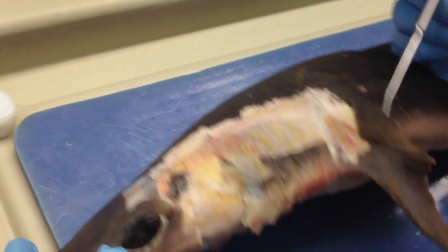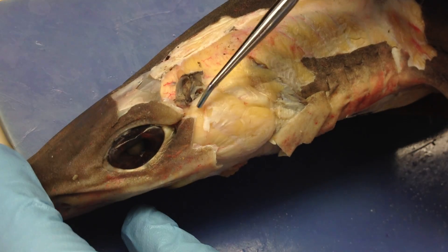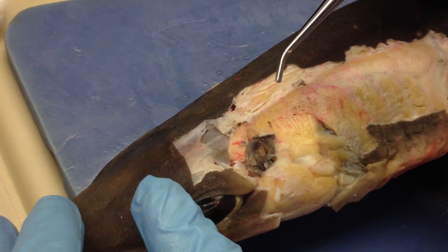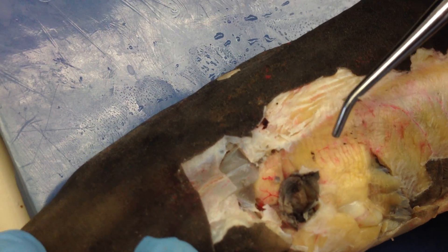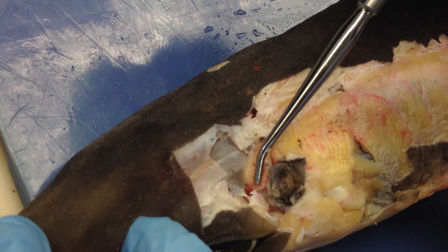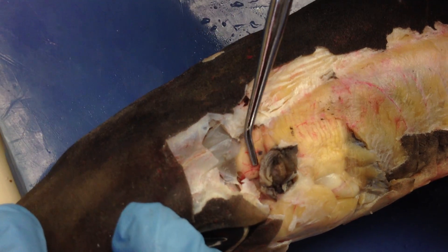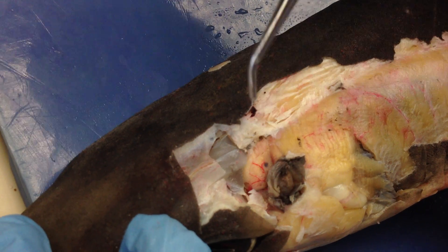The adductor mandibulae is located right here on the shark. The levator palatoquadrati is right cranial to the spiracle. Right underneath that is the spiracle muscle, which is this little flap almost.